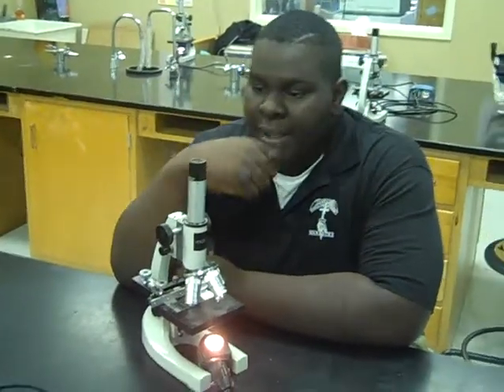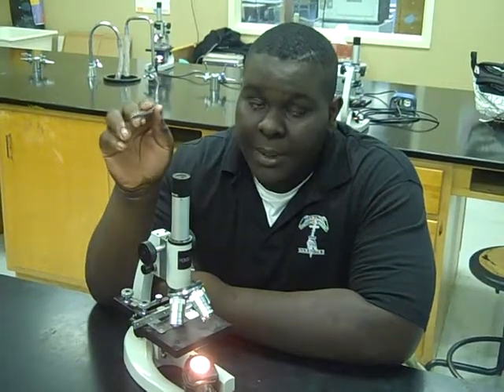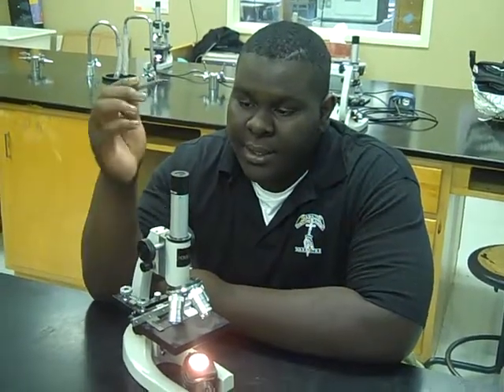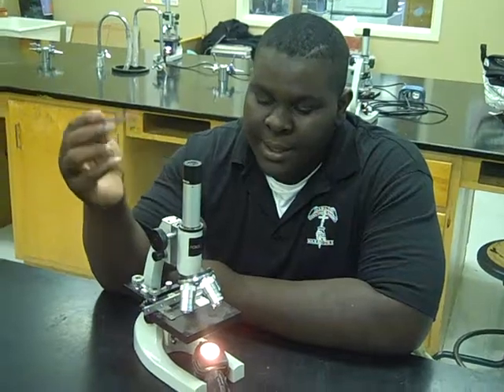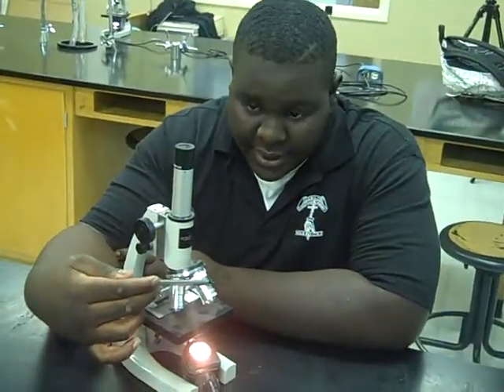This is a compound light microscope. A compound light microscope magnifies by multiplying the magnifying power of two lenses. The first lens is the eyepiece, and the next lens is the objective lens.